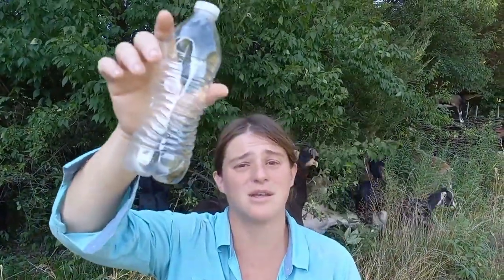I was going to film actually collecting the poop, but on the walk out to the field the goat I wanted to collect from just squatted and pooped. So I assume that if you have goats you've already seen them poop and you get the idea. I just put some pellets in an empty water bottle and used a stick or the cap to scrape them up into it so I can take it home and float it.